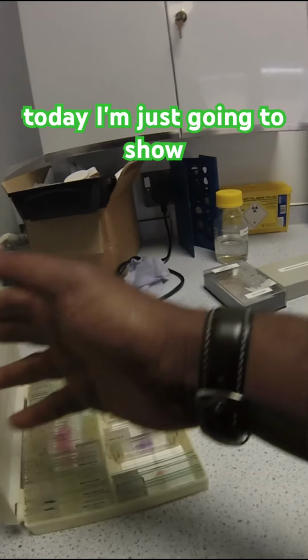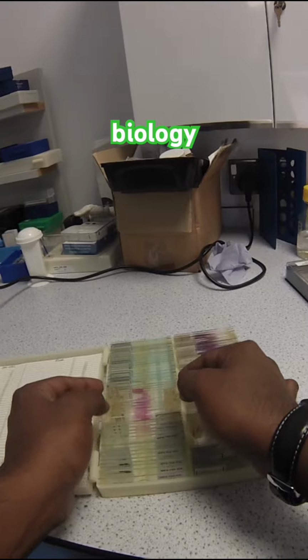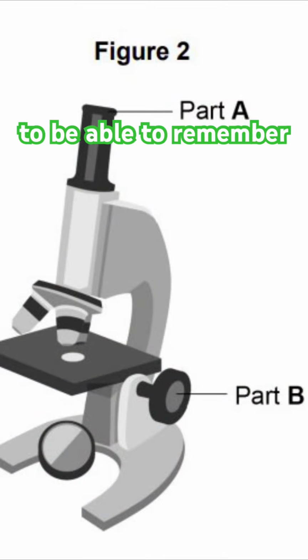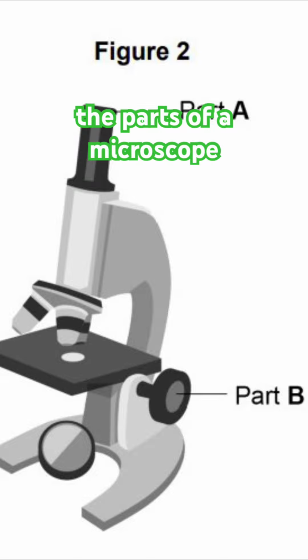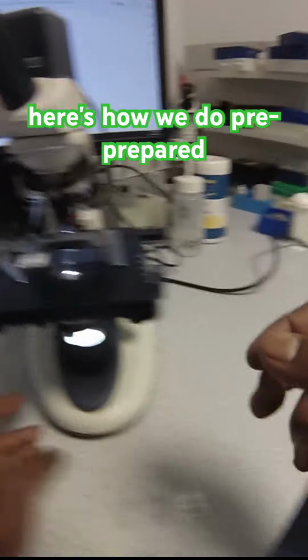So today I'm just going to show you how we use prepared microscopy slides across the whole of GCSE biology. Since the new specification abolished coursework, students are now expected to be able to remember the parts of a microscope, know exactly what they do and how they're used. Here's how we do pre-prepared slide sets.